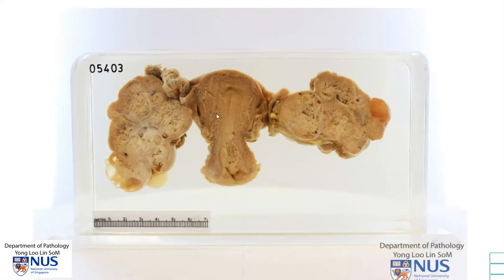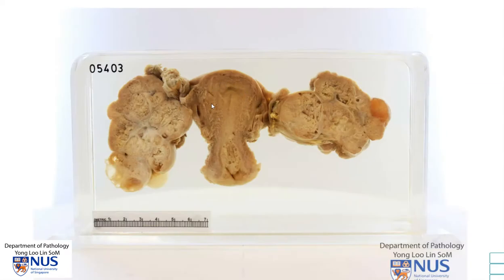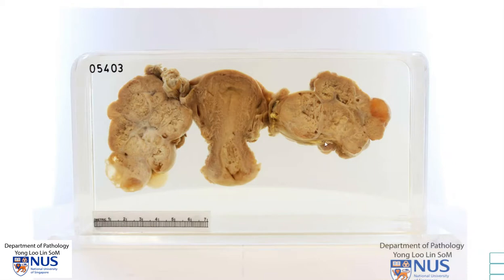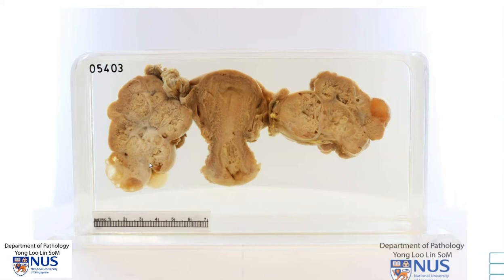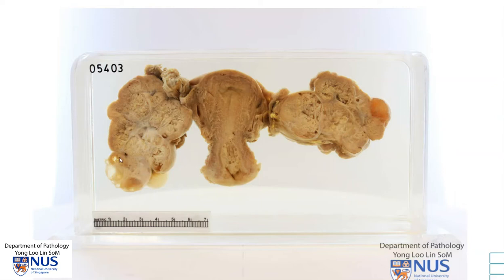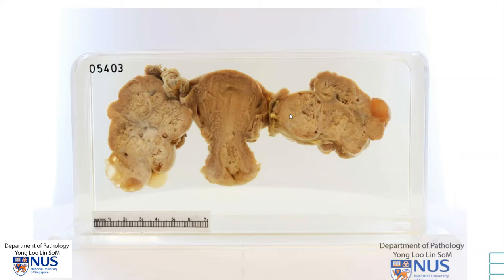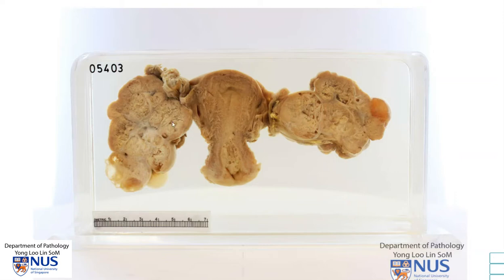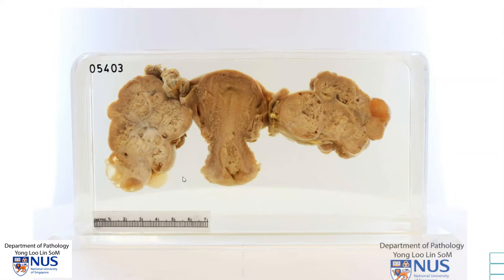In summary, this is a specimen comprising a uterus with bilateral adnexal structures. There are tumors that are predominantly solid but with a minor cystic component involving both ovaries, and the diagnosis is endometrioid carcinoma involving both ovaries. Thank you.